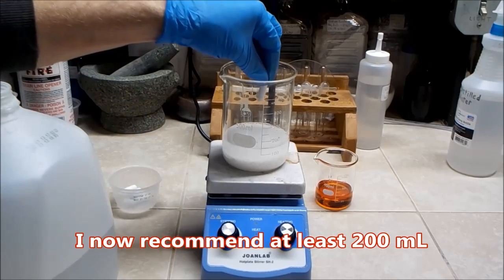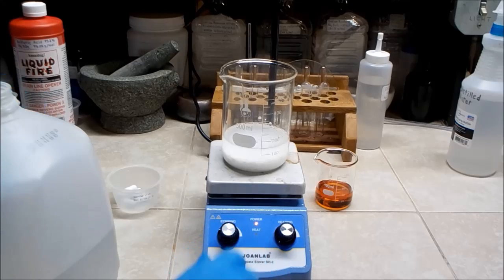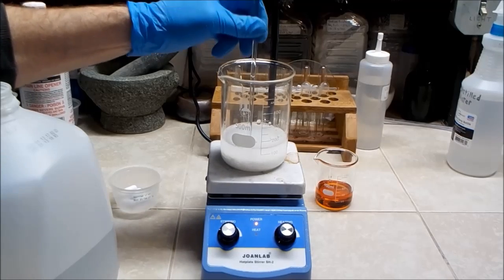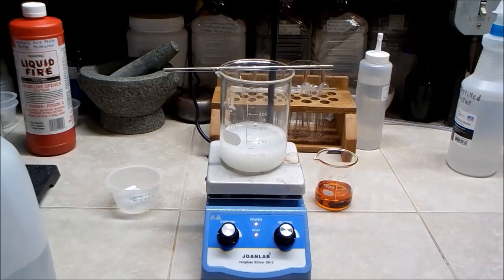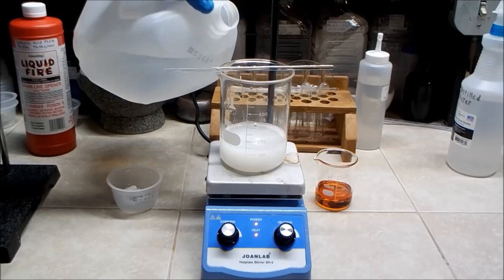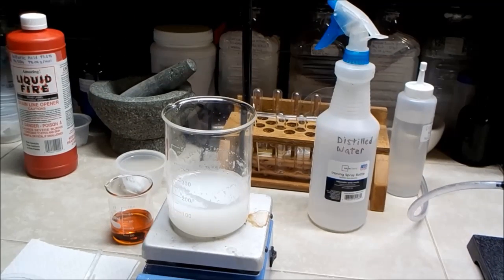I'm going to put in a stir bar, and with no heat, I'm just going to let that dissolve. As it has dissolved, the level has dropped a little, so I'm going to bring that back up just a little bit. Well, it's all dissolved, but it's cloudy. I don't know why, but I'm going to proceed anyway.